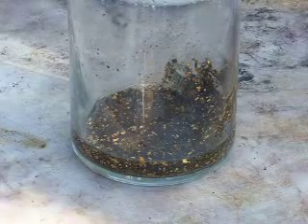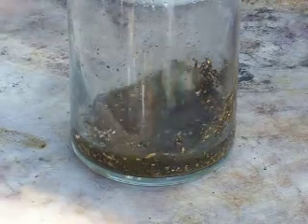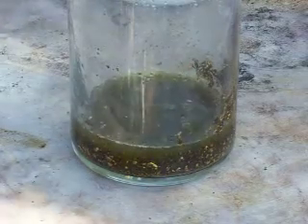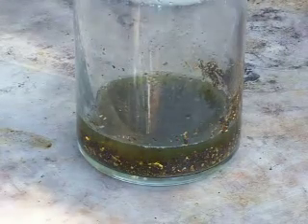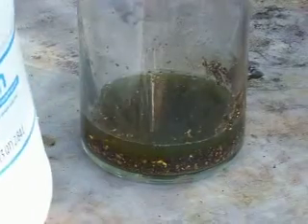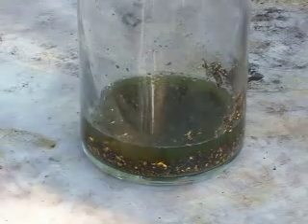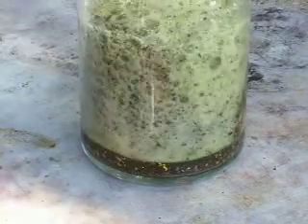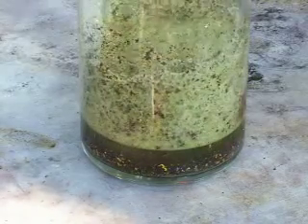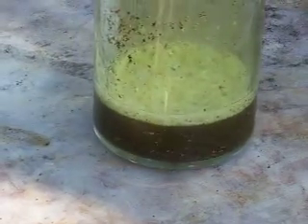There's leaves, a little dirt, some plastic, whatever — but we're going to process them just like they were clean. Just a little muriatic acid, it doesn't take a whole lot, and the bleach. When these two are combined it creates a very toxic gas — chlorine gas. It was used as a weapon in World War One and World War Two. It's highly toxic, so it's nice there's a breeze blowing outside and I'm staying upwind.